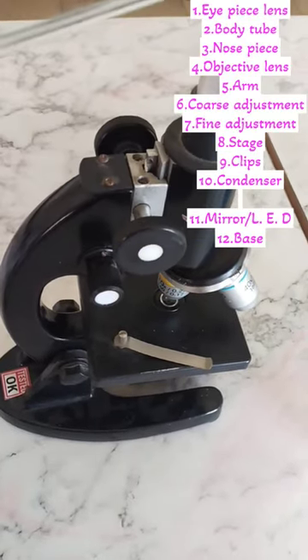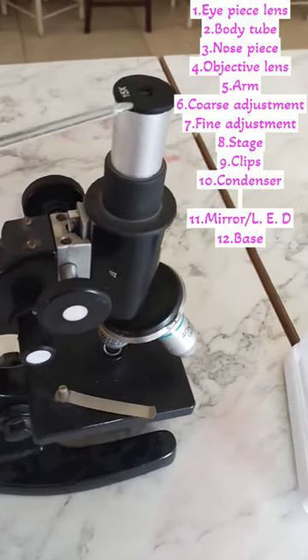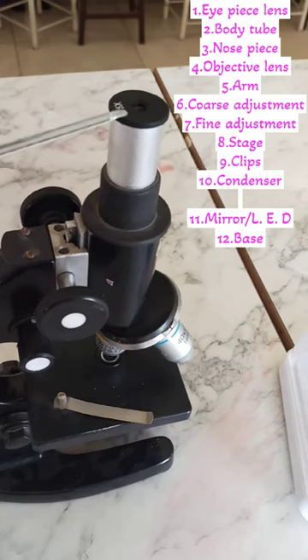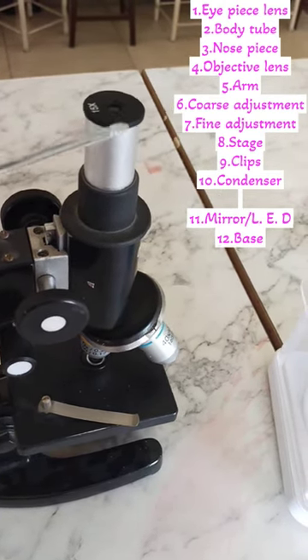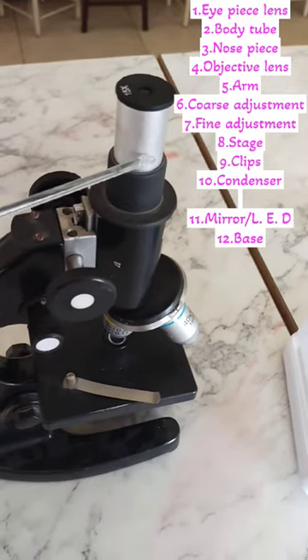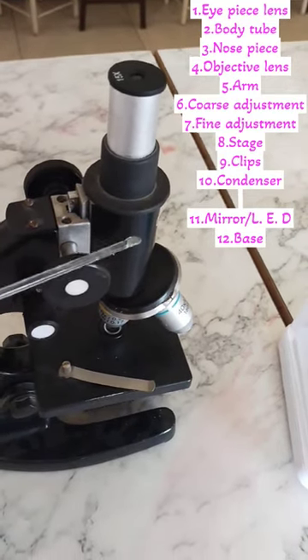Hello friends, today we will go to the compound microscope. First of all, you can see that this is an eyepiece lens. The eyepiece lens is normally 10x and 15x. Here they are 15x.